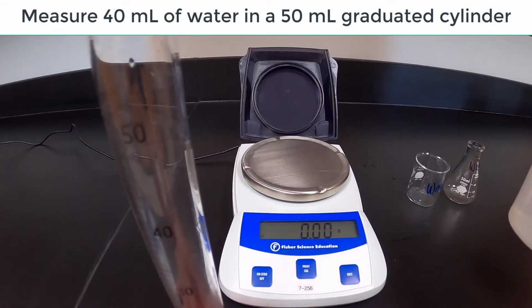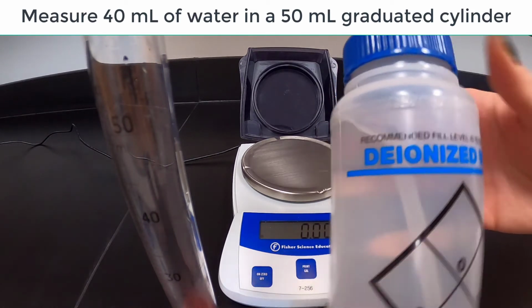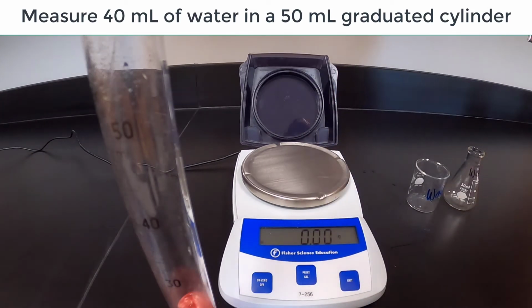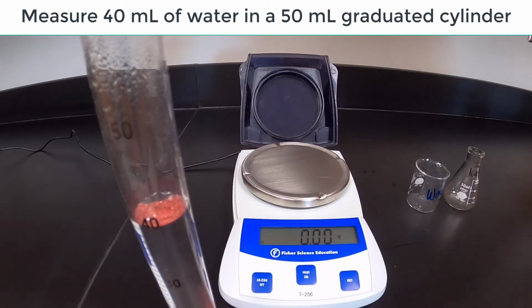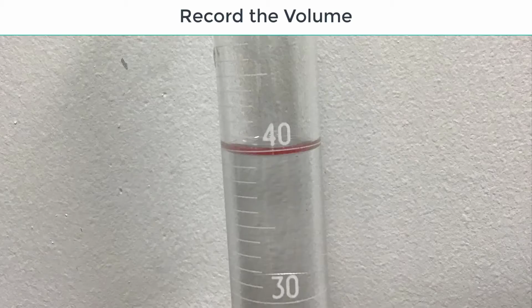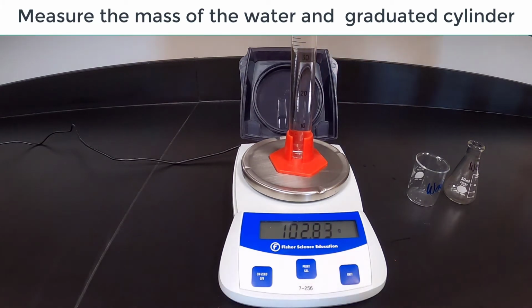Measure 40 ml of distilled water into the graduated cylinder. Record the volume. Reweigh the graduated cylinder with the water. Record the mass. Calculate the mass of the water.